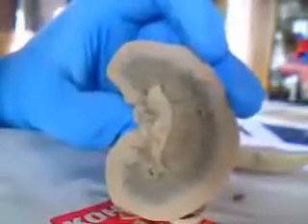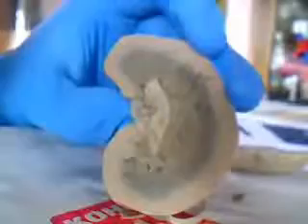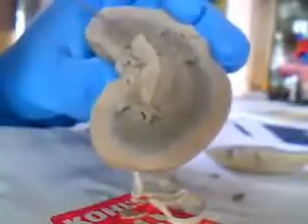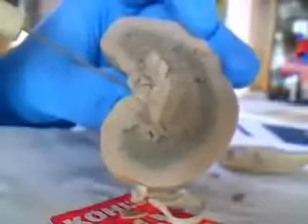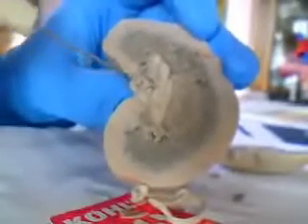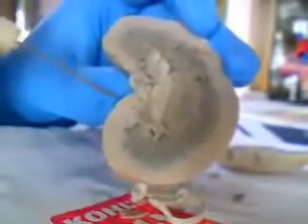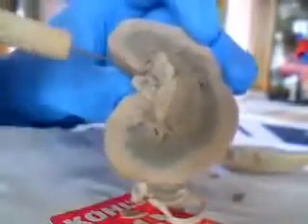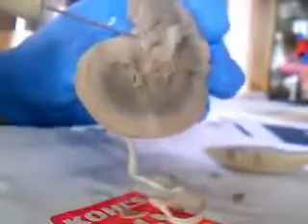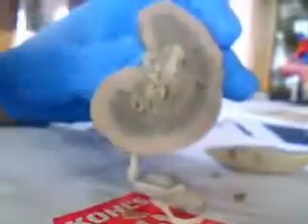One more thing I forgot to mention was the renal artery and the renal vein. Unfortunately, I couldn't seem to locate them. The renal artery would be a red vessel coming out here, and the renal vein would be a blue one coming out here. Unfortunately, as I was digging around, I just could not see it, so I was wondering maybe it just was not included in this part of the kidney.